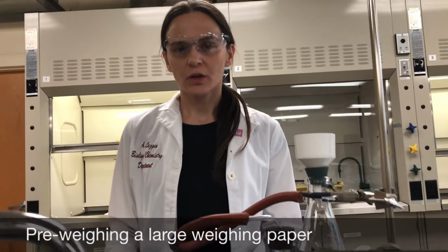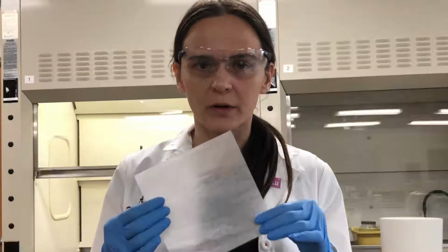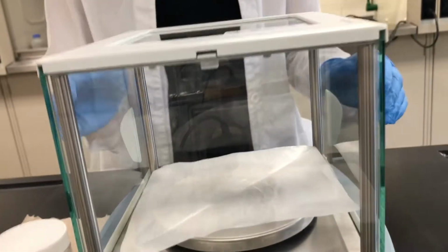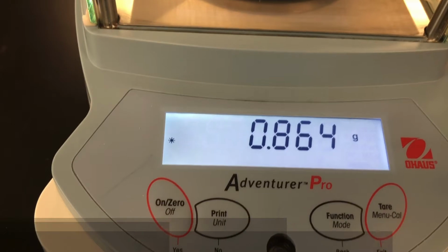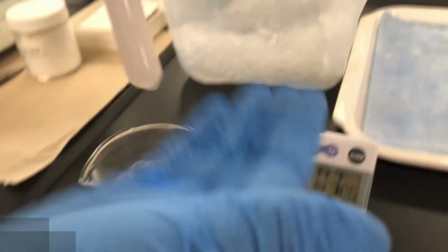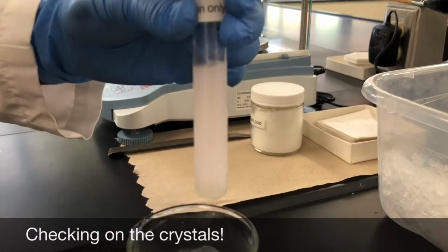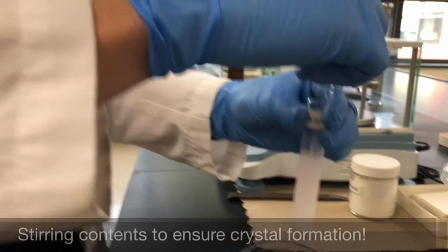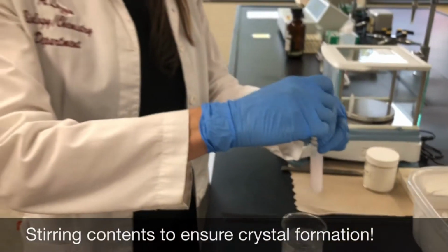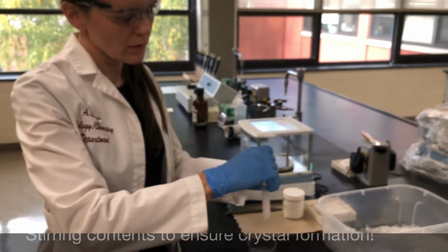So while waiting for the crystal formation, I'm going to weigh a piece of large weighing paper. So this is where crystals of aspirin will be transferred onto. By the cloudiness, crystals indeed are forming. And I'm going to give it a stir just to ensure crystal formation. So I'm scratching the inside of the test tube.